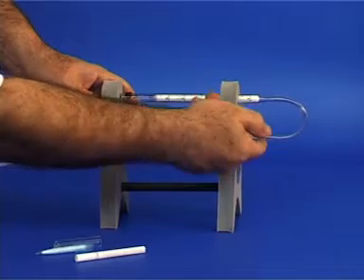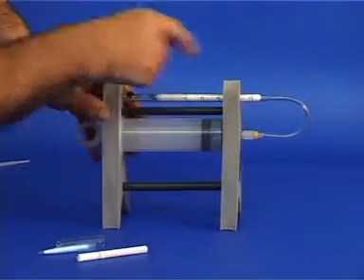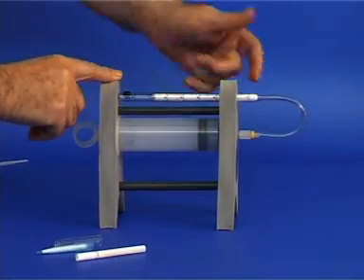Here we have a vacuum pump connected to a long cotton filter. This is in order to protect the pump from contamination.